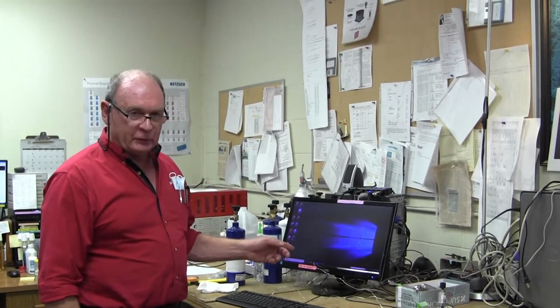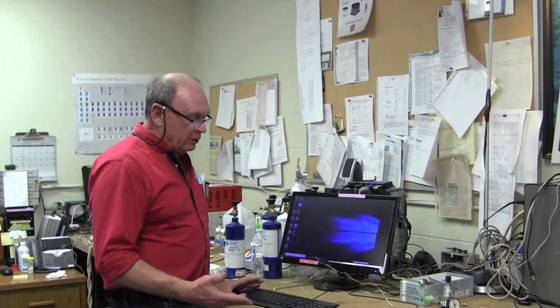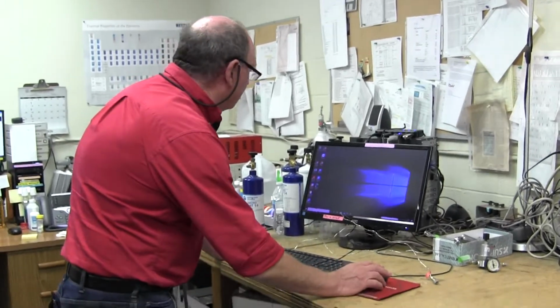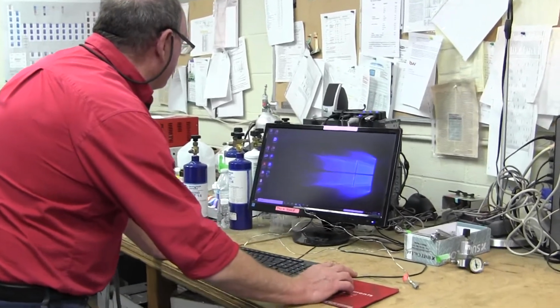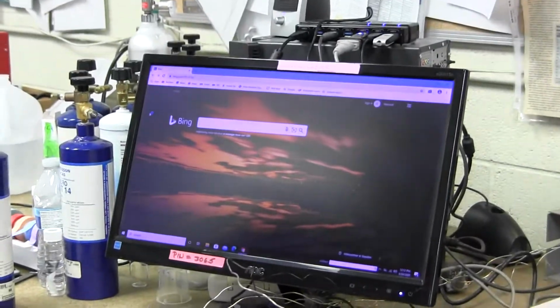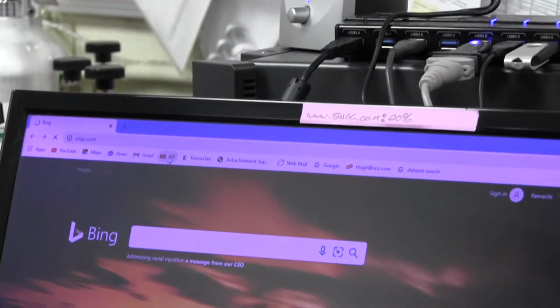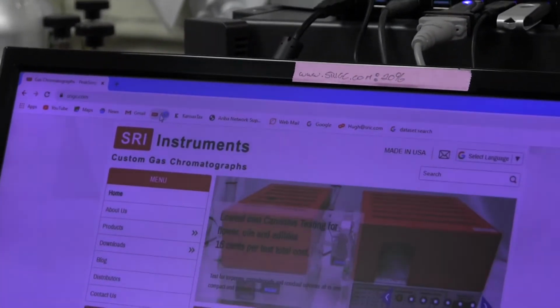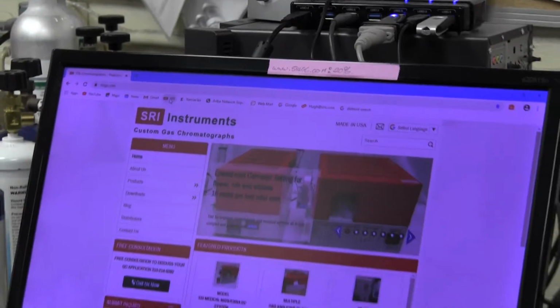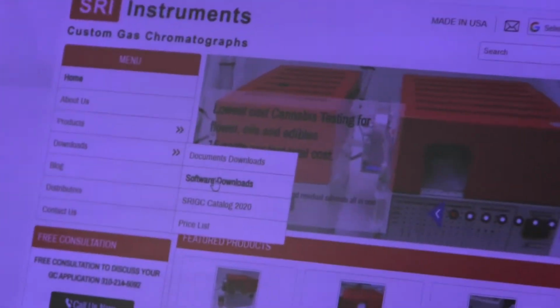Today we want to talk about what to do if there's a problem connecting the Peak Simple software that comes with our gas chromatographs to the computer. So sometimes there's a problem. We'll go through the process of going to the internet, and then we'll go to the SRI website, which is srigc.com, and then click download and then software downloads.